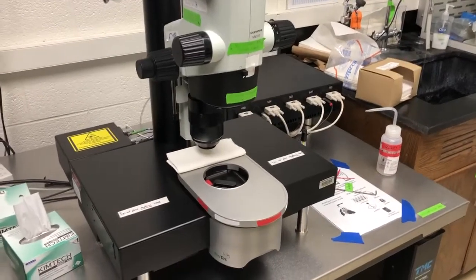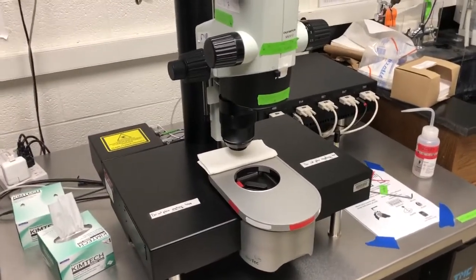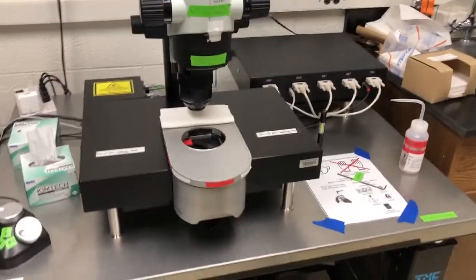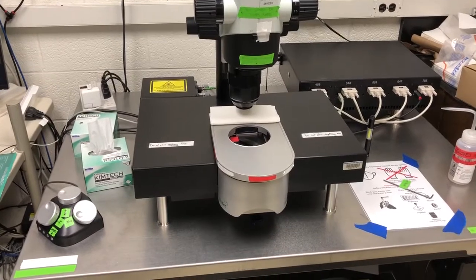Let's talk now about how to keep the microscope safe. There are two sources of danger to the microscope, things that you can do that will break it.